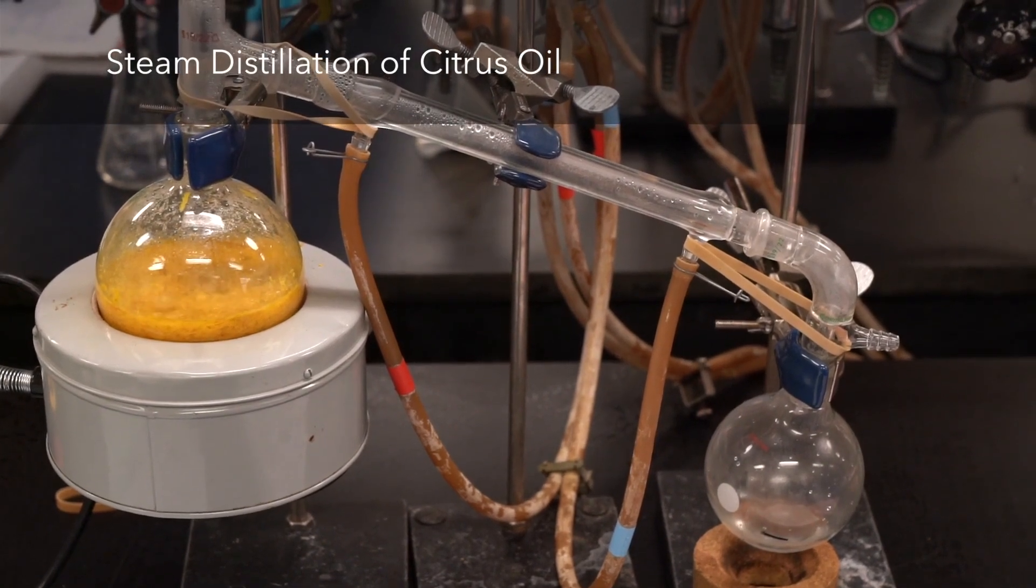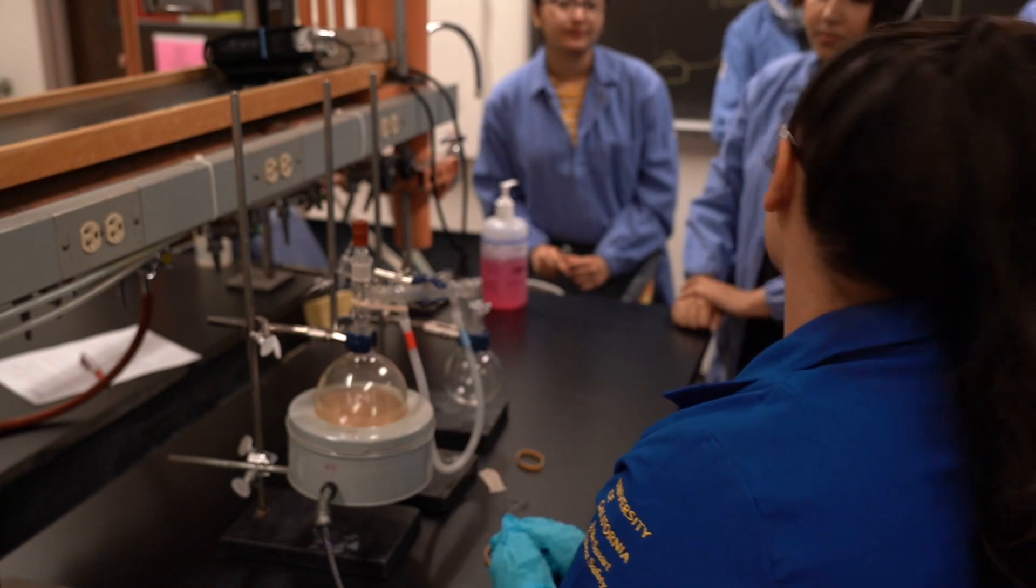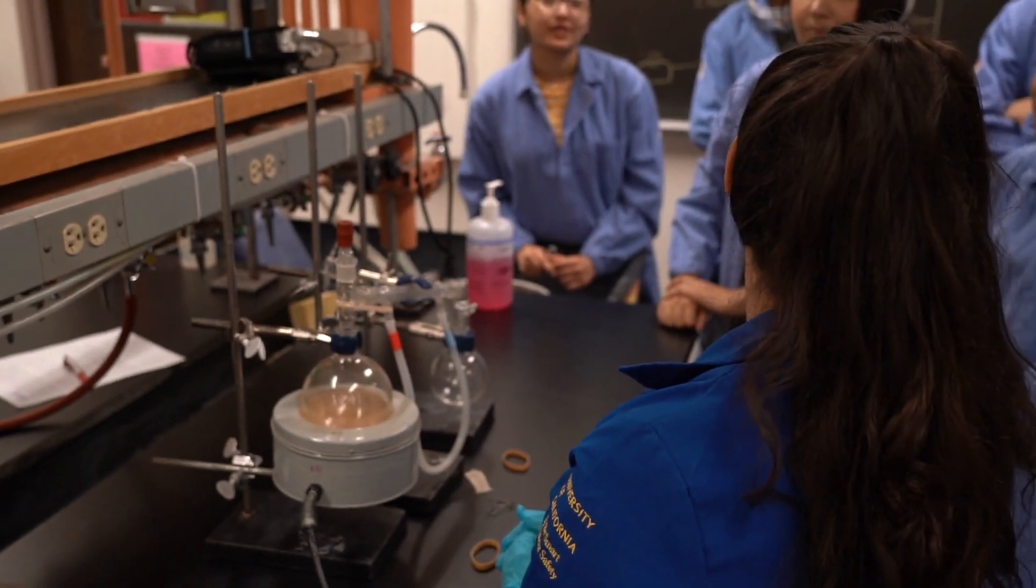So the peels and water should already be in there, because I don't want to take all that off and go, oh my god, I forgot the whole thing.